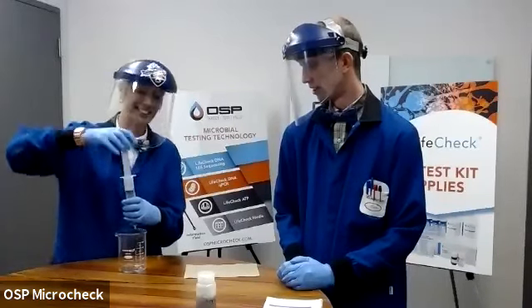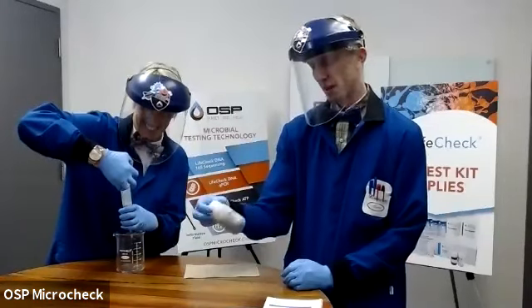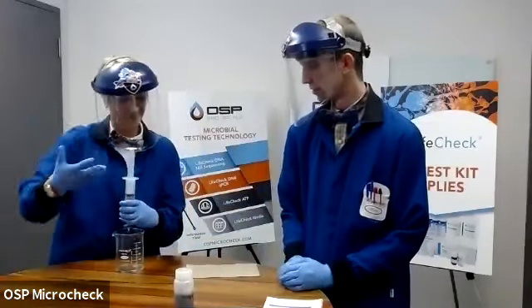How are you doing there, Virginia? Are you going to get the full 50 mils? I don't think it's going to work. Yeah, there is some sediment in this sample, which does make it a little bit more difficult to filter by syringe.